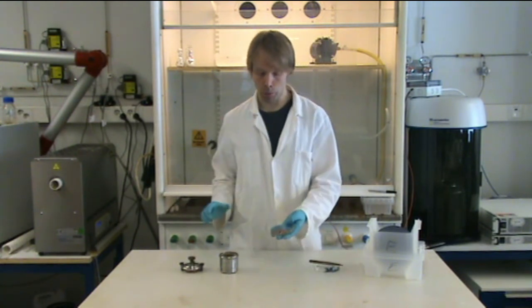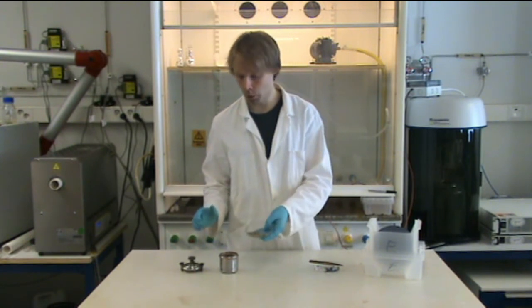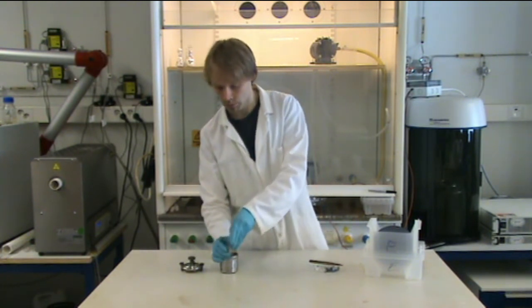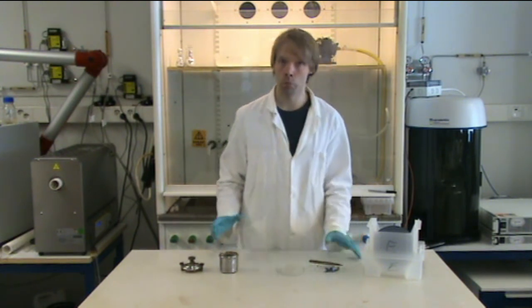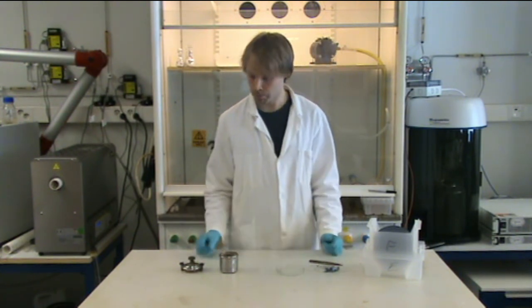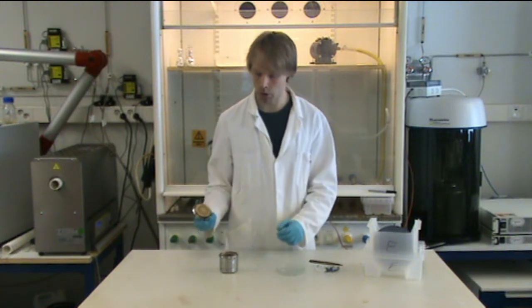Then we will place the grinding balls into the jar. In the case of producing nanoparticles, we would also add liquid. Next I will close the grinding jar.